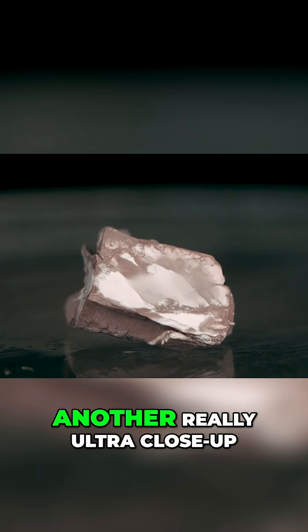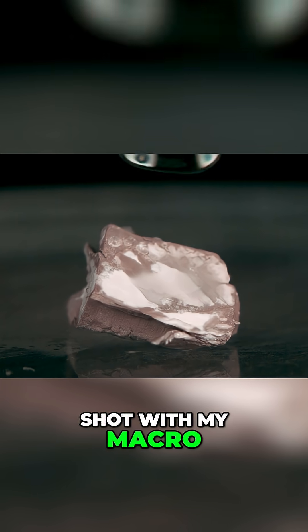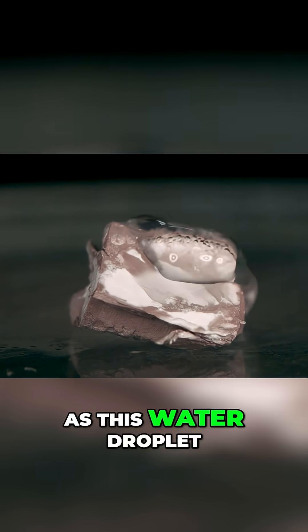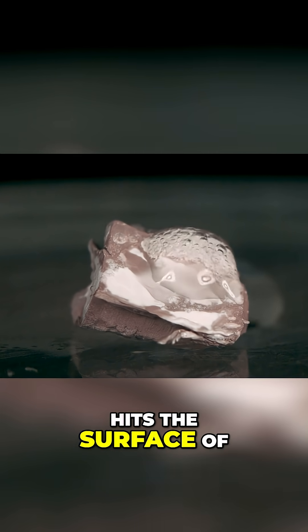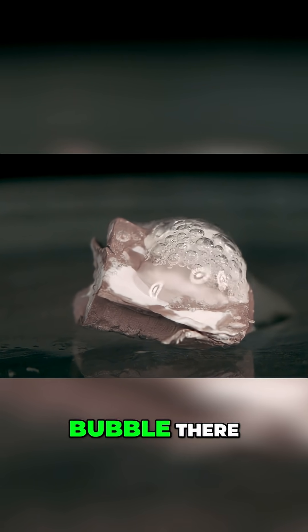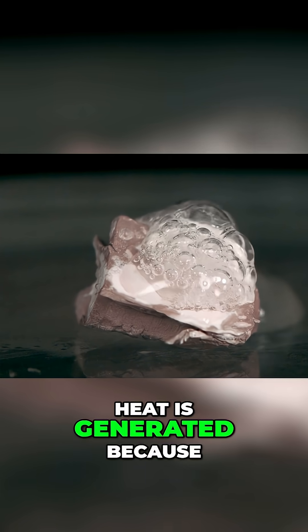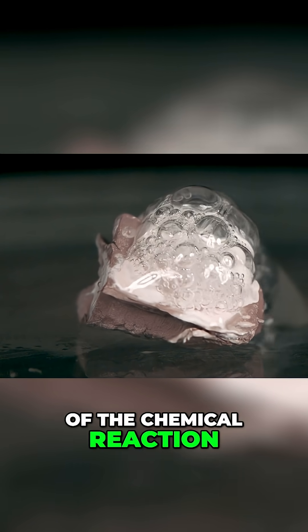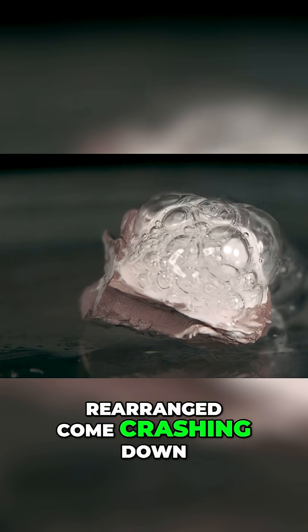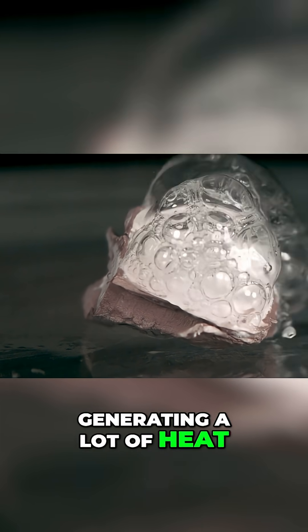Here, I wanted to get another really ultra close-up shot with my macro lens in slow motion. You can see that again, as this water droplet hits the surface of this sodium, it immediately begins to bubble, producing hydrogen gas. Heat is generated because of the chemical reaction and the electrons being rearranged come crashing down into lower energy states, generating a lot of heat.